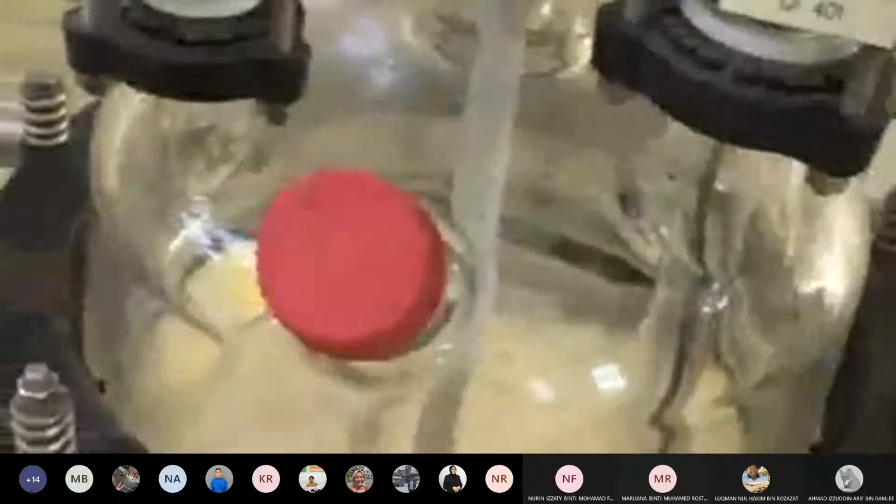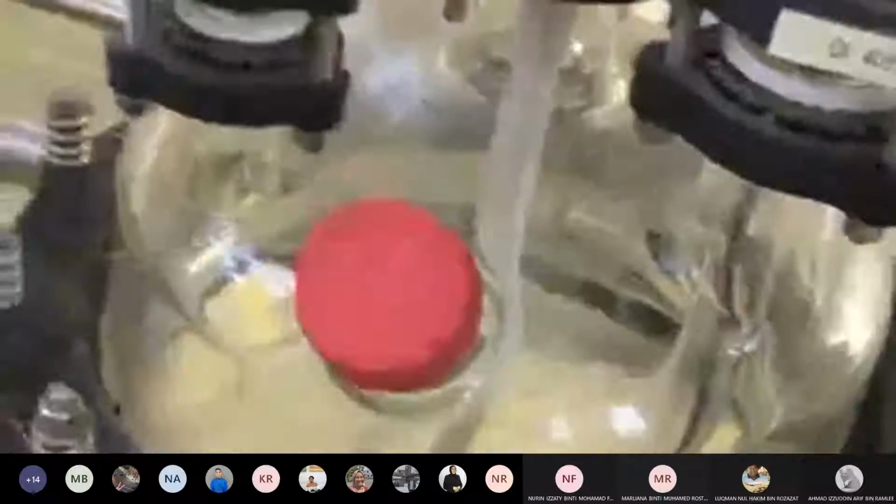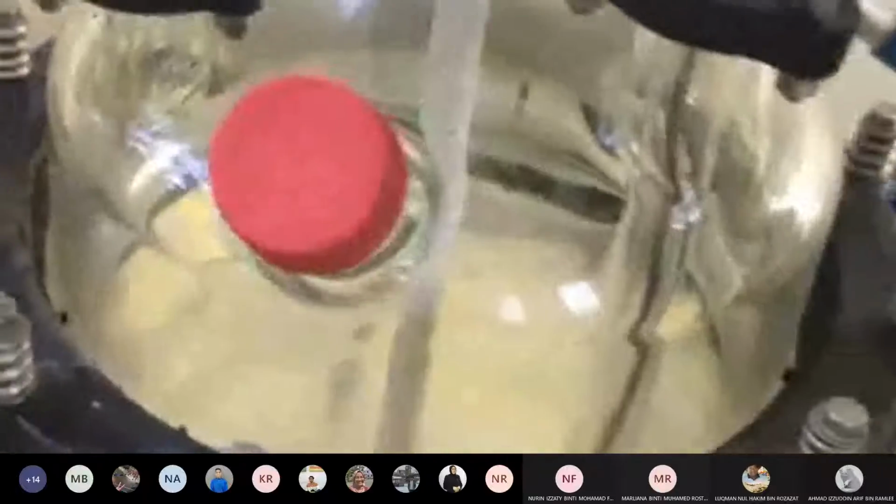So you will see that from this conductivity probe, you will get the reading of the conductivity, and then you record that conductivity. Then you will know what the concentration is. It means that from the conductivity calibration table given, you have to plot a graph. That graph we call the calibration curve. From the calibration curve, you will get an equation. You use that equation to relate your conductivity reading back to concentration.